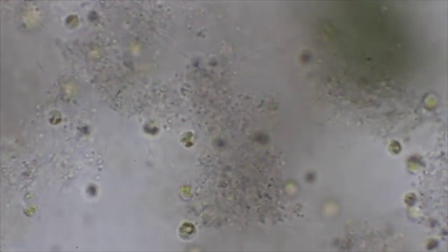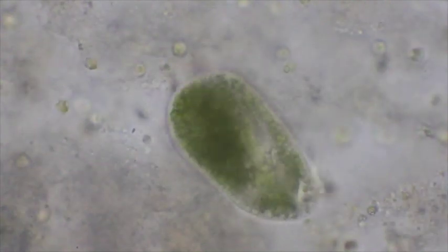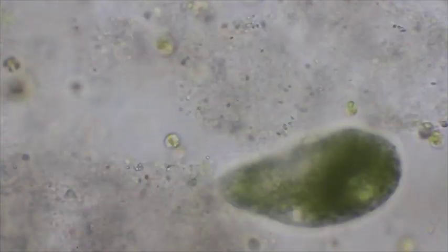And so here's our paramecium bursaria right in the center under 10x magnification. I'm going to increase up to the 40x objective, 400x magnification. We'll center this guy in here and focus. And you'll notice the color on this guy. First of all, it is green. By being green, it would appear to be similar to a photosynthetic organism, but it's a paramecium. And the other paramecium we looked at was heterotrophic.